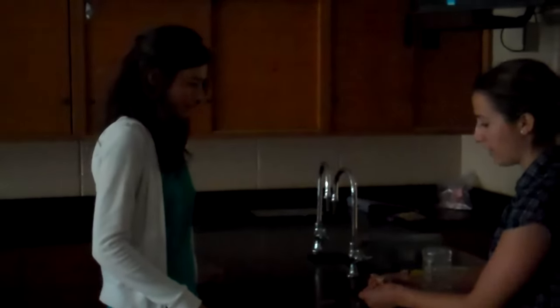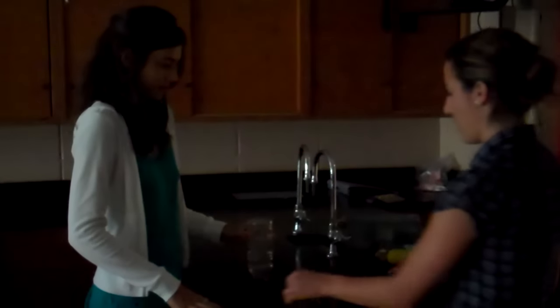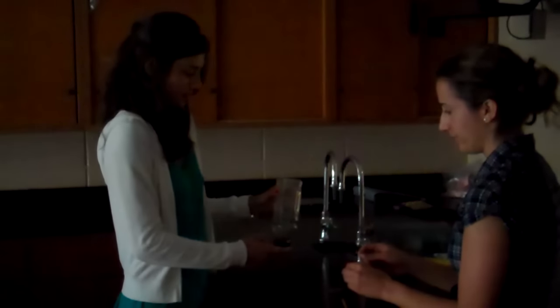Basically, what you've got to do is you've got to light the match — someone has to hold this. Light the match, then light the wood splint. And then Amanda's going to take the cover off.